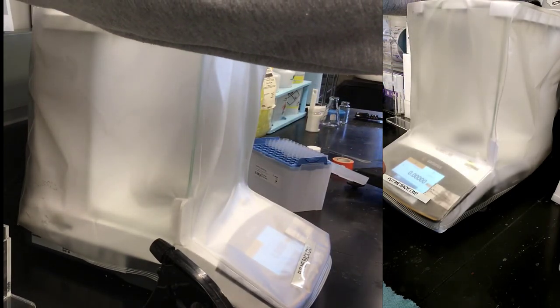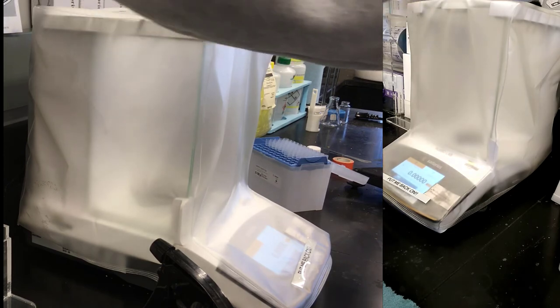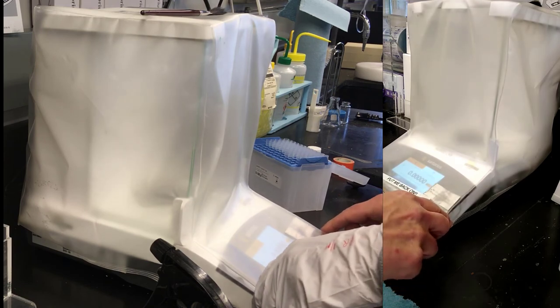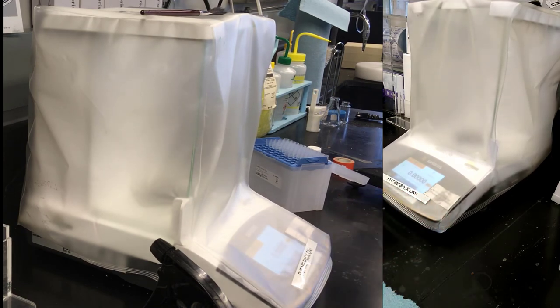Okay. So, I guess I showed you that it's pretty simple to use. And we try to keep the surfaces clean. And it's the cleanest balance I know that's 7 years old.